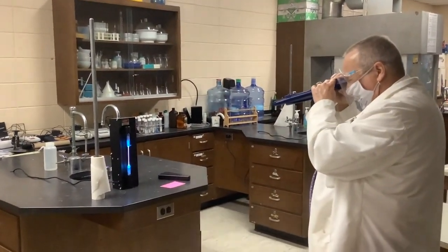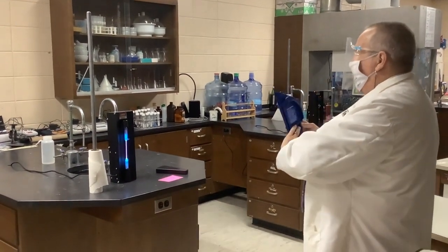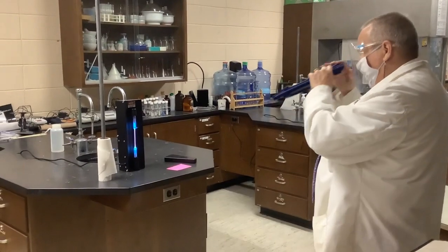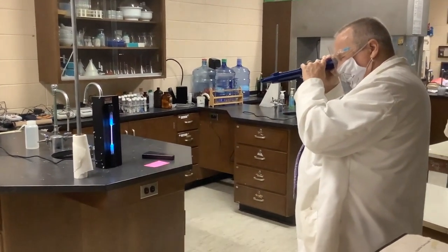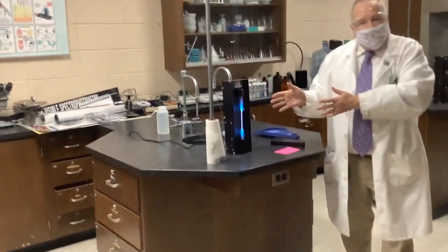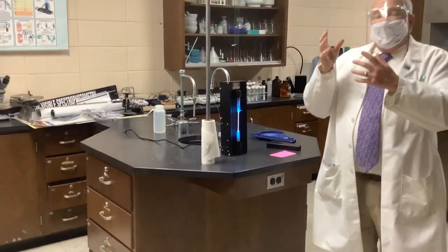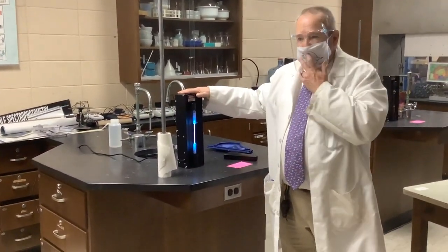And you can use either one of these. I rather like these. These have a really clear number system on them. If I can get the window, there's the window. Over on that side. Oh, beautiful. I wish I could show you. But what this is, is mercury vapors inside a tube. They're being excited by a very high energy current. You can hear the transformer buzzing.